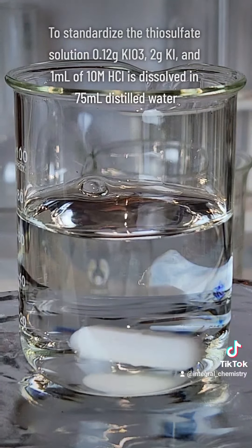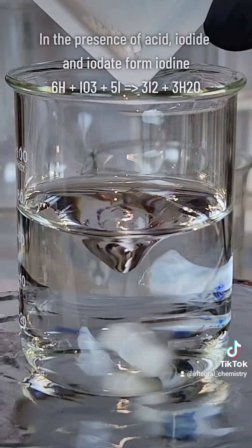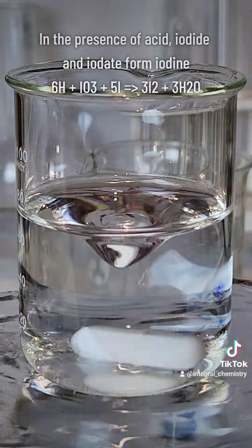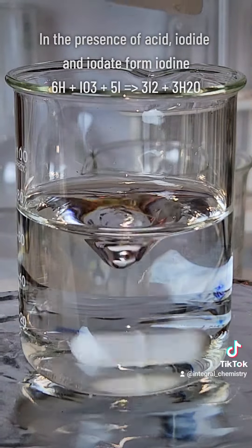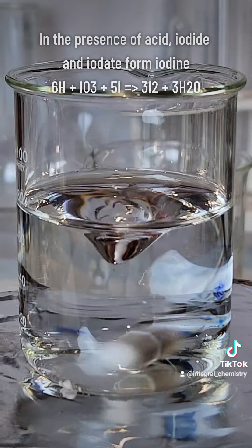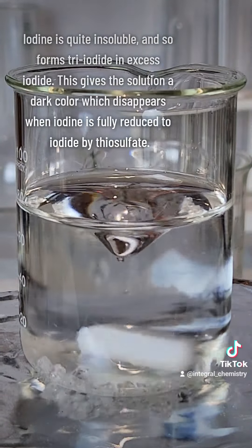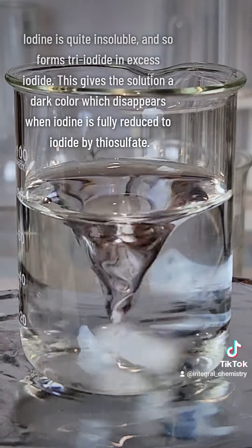I then create two standards using potassium iodate, potassium iodide, hydrochloric acid, and water. A blank is also prepared which includes all of those ingredients with the exception of the iodate.